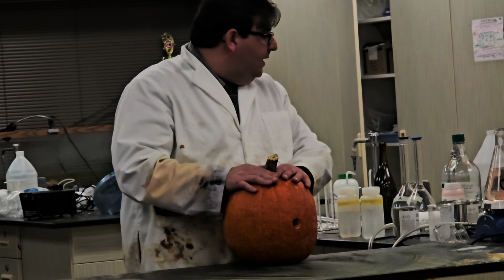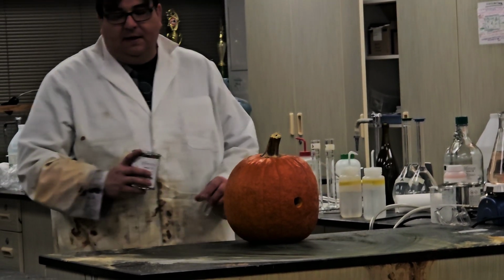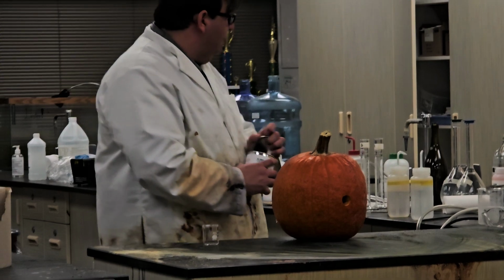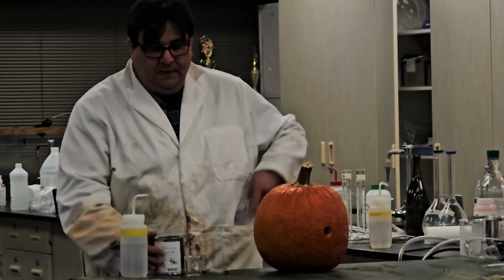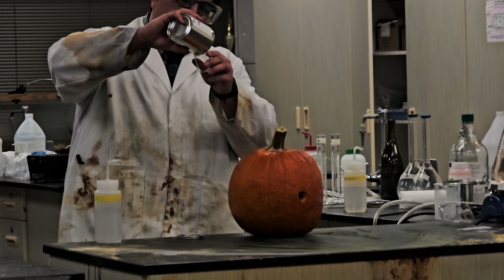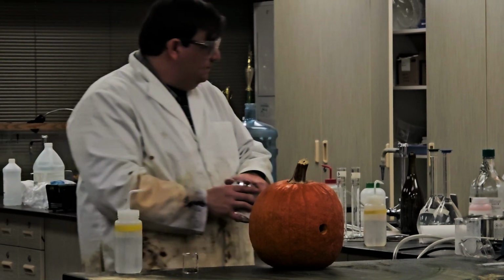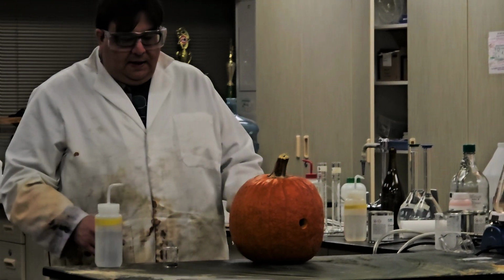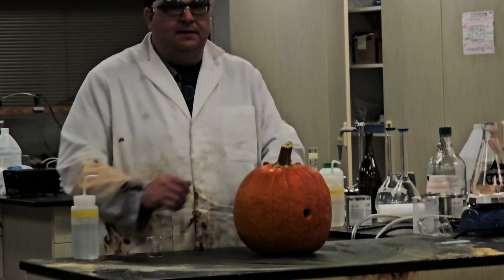So I want everything just to be done all at once. So I'm going to take some magic rocks here, and we're going to have all the things happen all at once.